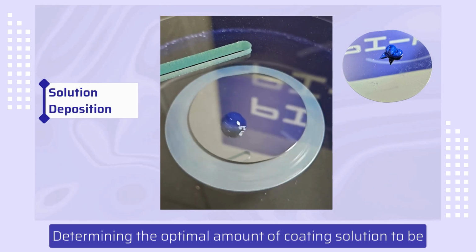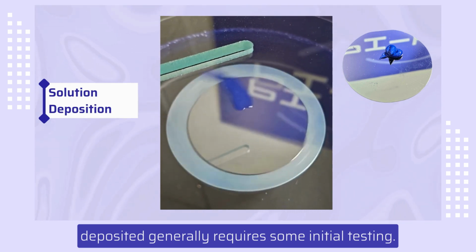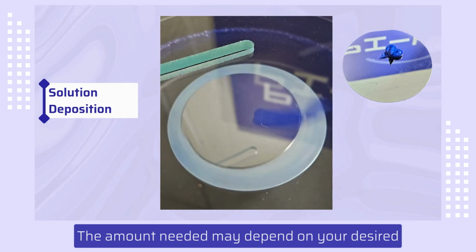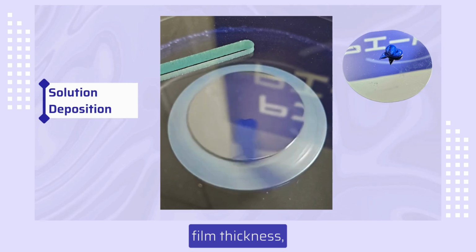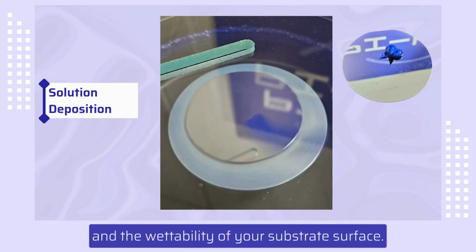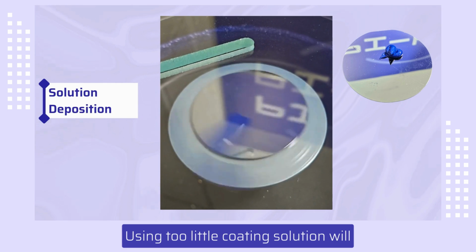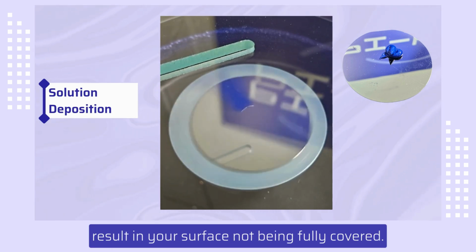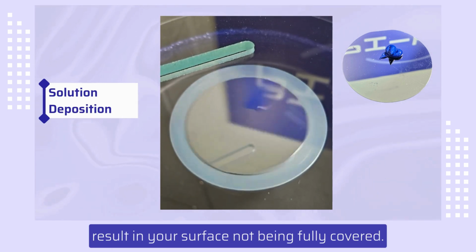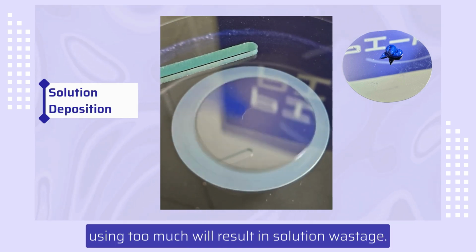Determining the optimal amount of coating solution to be deposited generally requires some initial testing. The amount needed may depend on your desired film thickness, the viscosity of your coating solution, and the wettability of your substrate surface. Using too little coating solution will result in your surface not being fully covered. However, using too much will result in solution wastage.